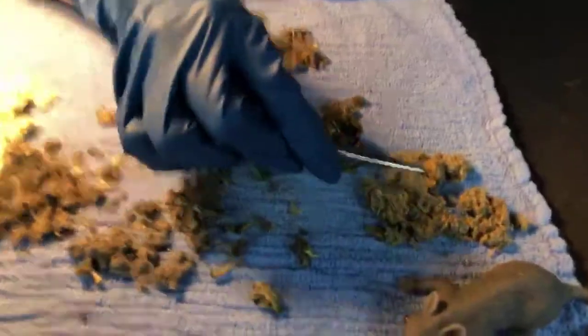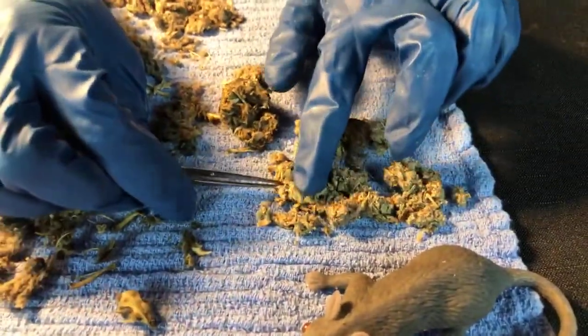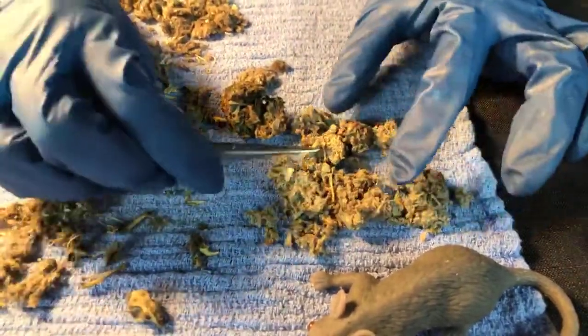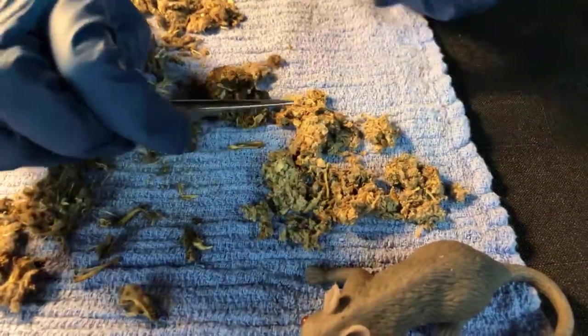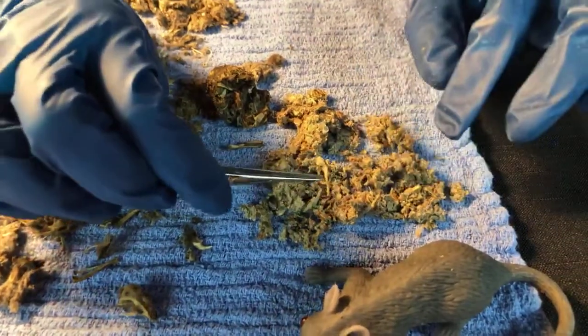Thank you. And this is a raven, and I had never dissected a raven pellet, so I thought it'd be kind of fun. So, do other corvids cough up pellets? Yeah, and this one is from a resident raven that we took care of. He coughed up the pellet, and I believe this was the time he had fish.